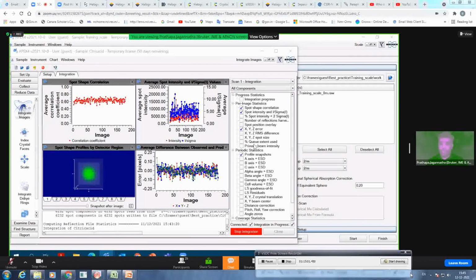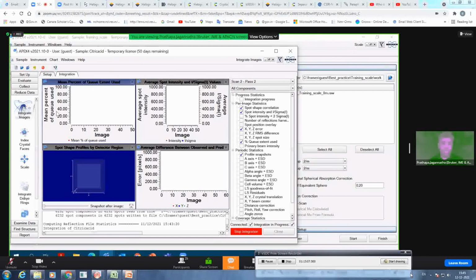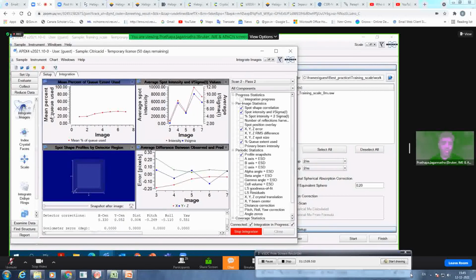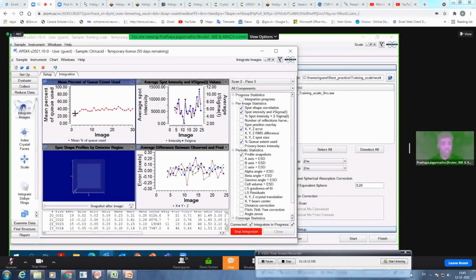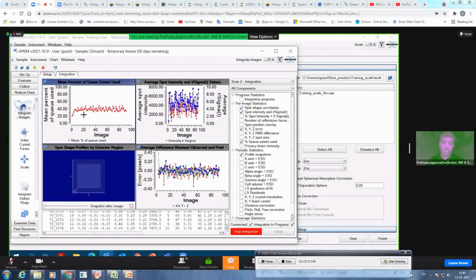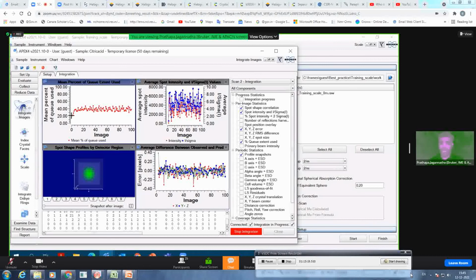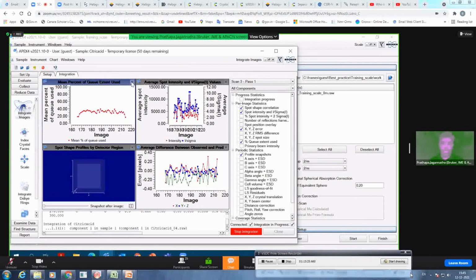That is here, percentage queue extent used. If I click on that, I can see the graph has come. That's the mean percentage of queue used. If it is around 20, 30 or 40%, it is okay. But if it is exceeding 60, 70, 80, try considering increasing the frame queue from 7 to 10, or 8 or 9. Okay, that's one of the feedbacks you can see from this graph.